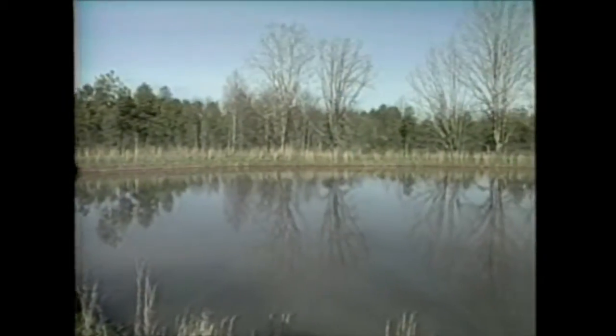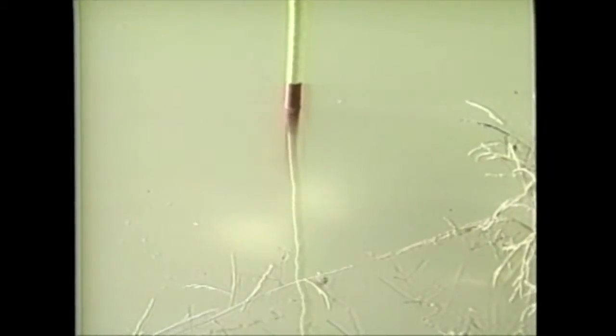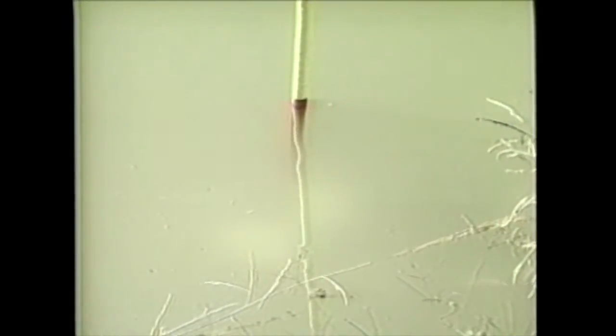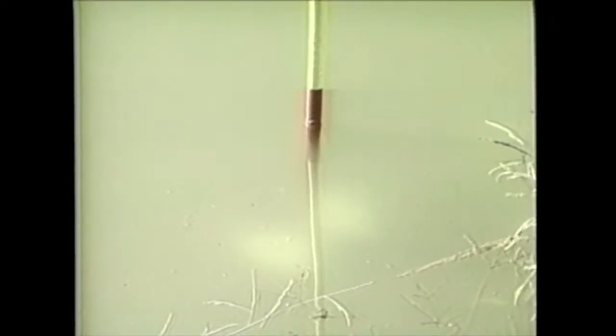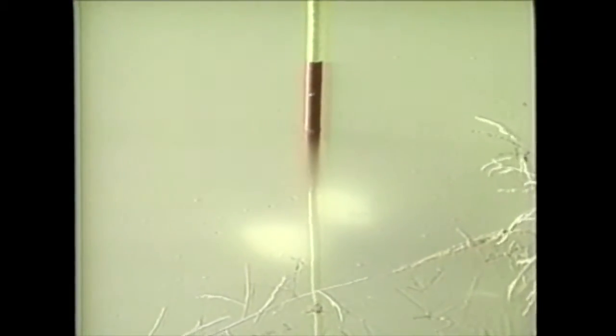However, in some ponds, turbidity may be due to suspended clay. If this situation exists, the clay must be removed to ensure phytoplankton growth. Consult your county extension agent or aquaculture specialist if this problem exists. To obtain the Secchi disk visibility reading, the disk is lowered into the water until it just disappears and the depth is recorded. The disk is then lowered a little deeper and then raised until it just reappears. The depth at the reappearance of the disk is also recorded. The average of the two readings is the Secchi disk visibility.